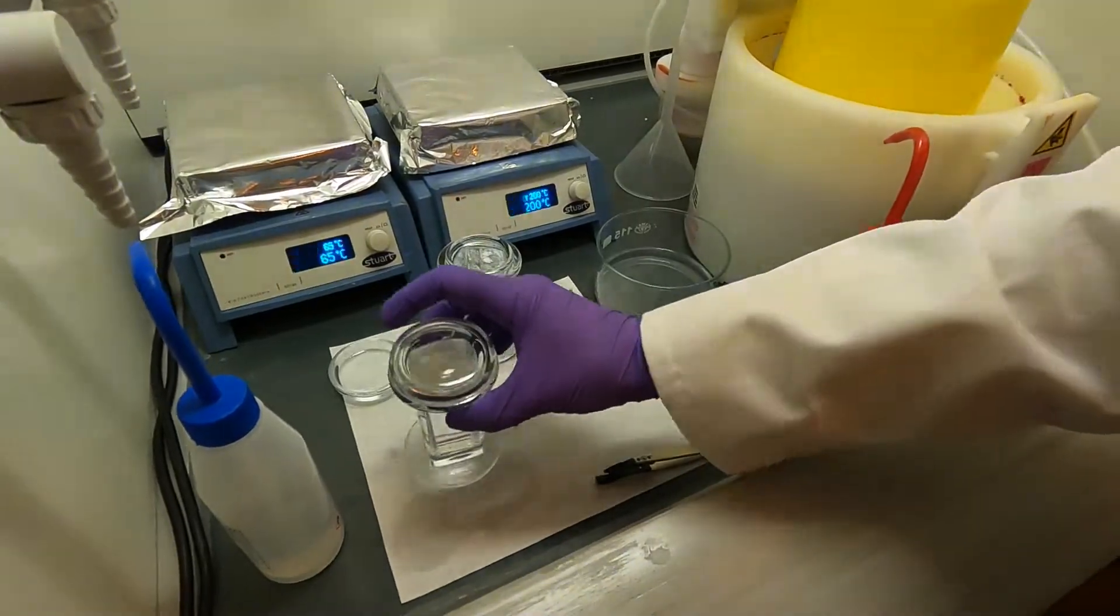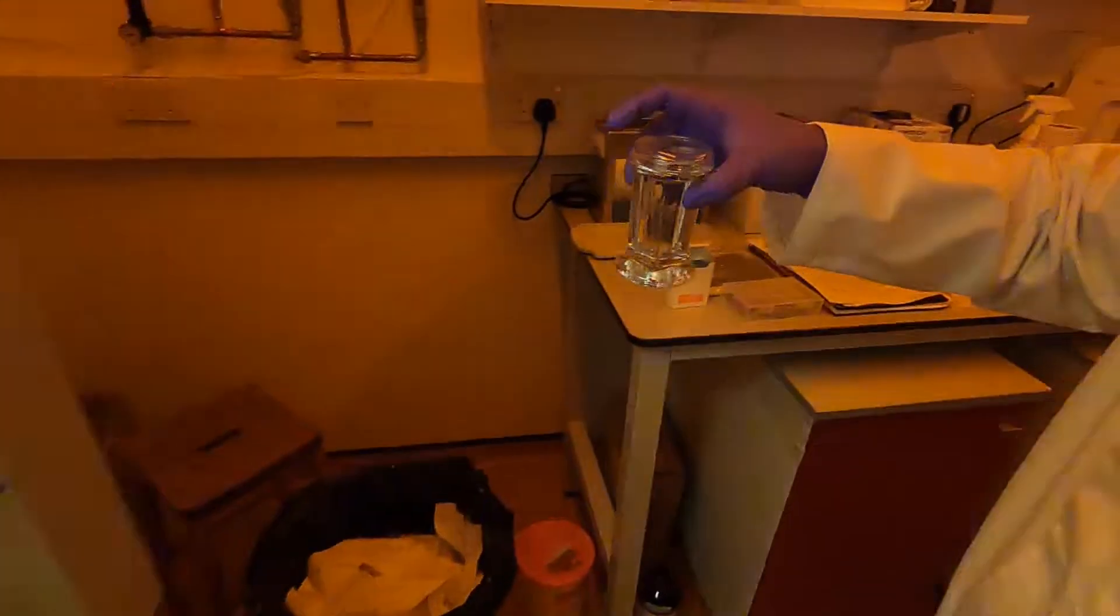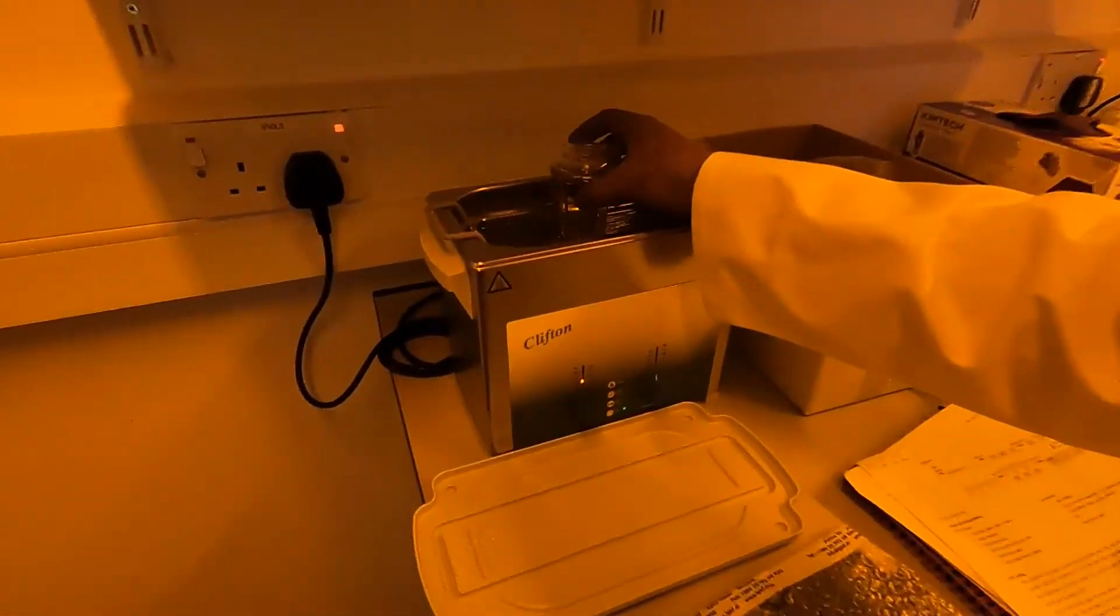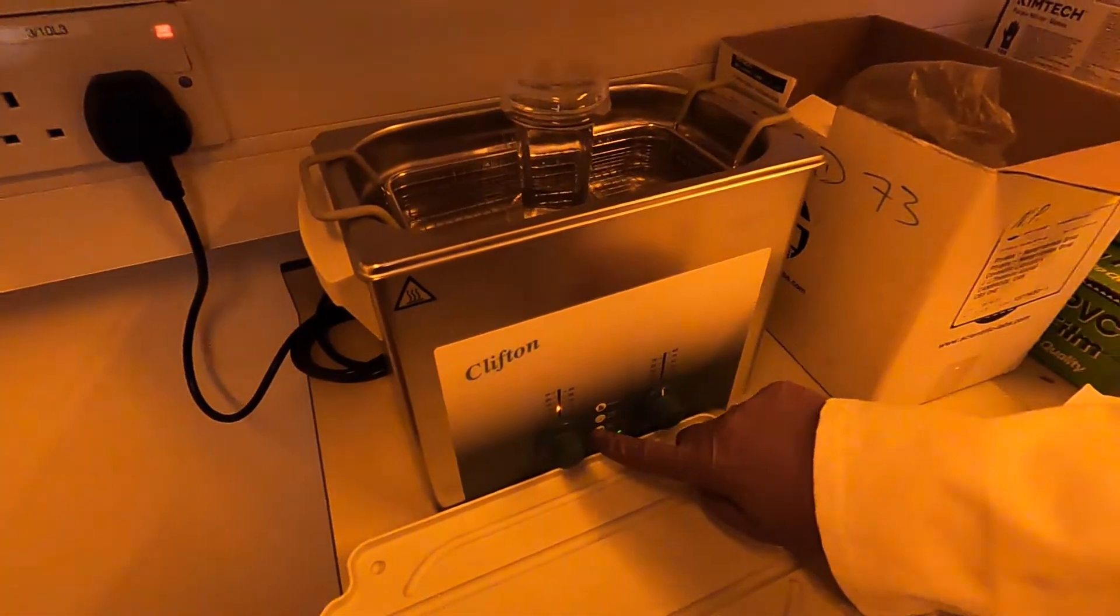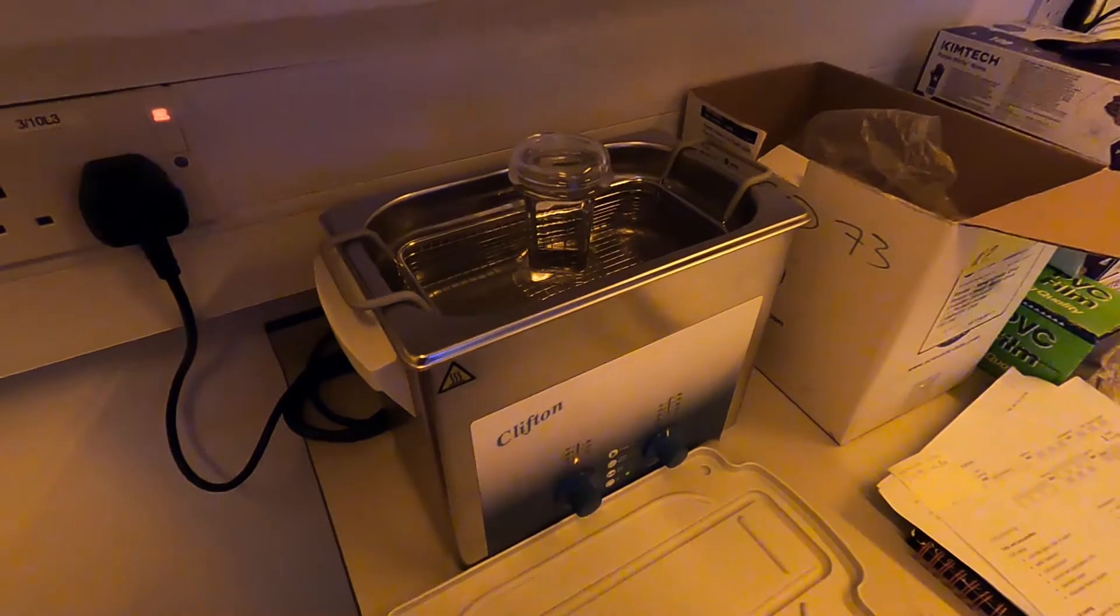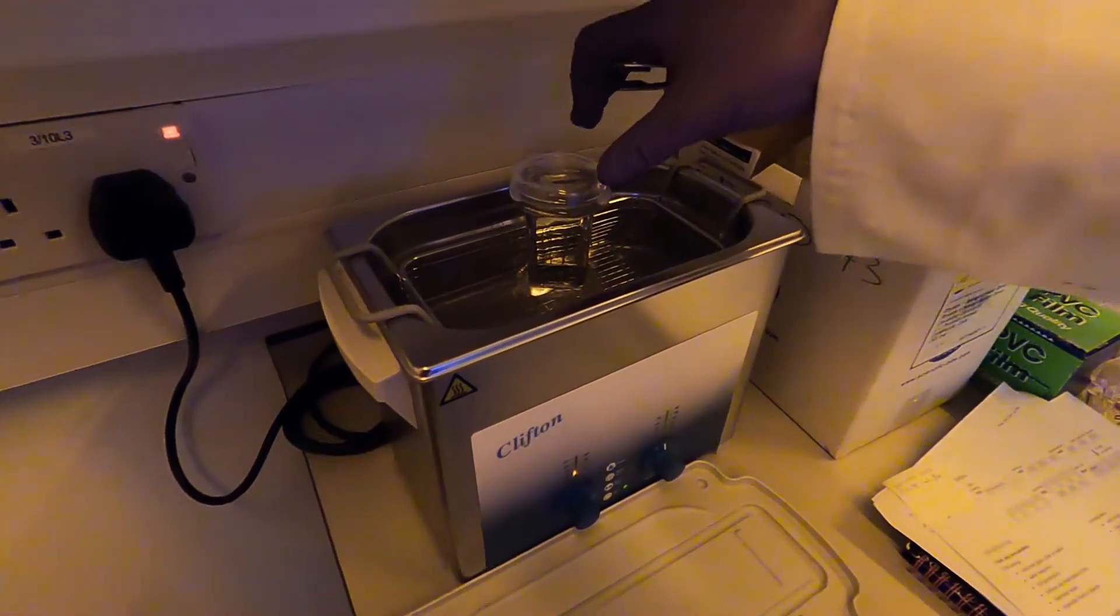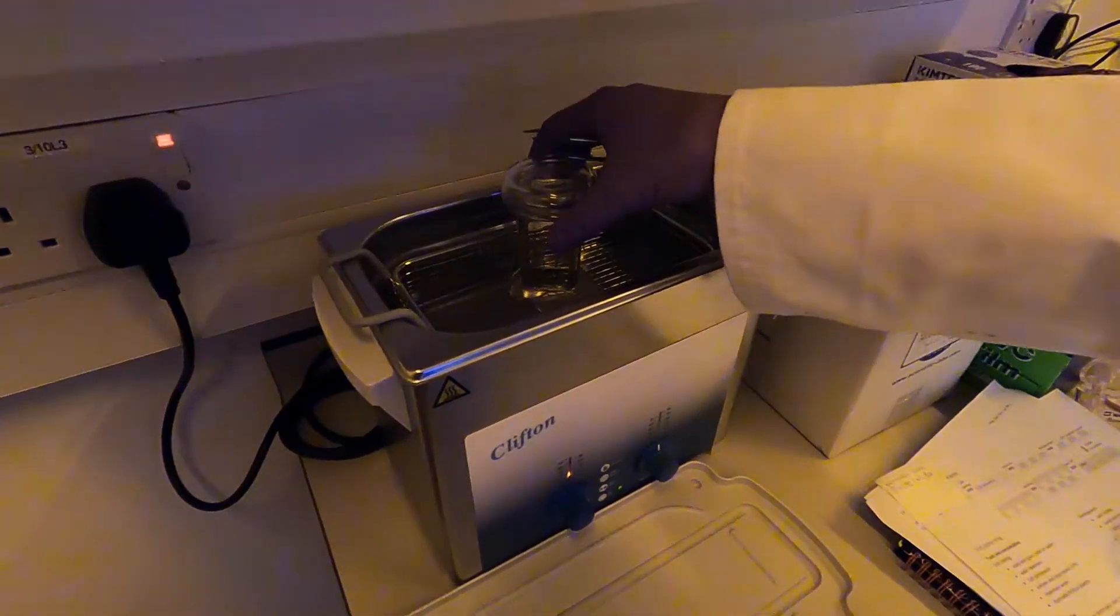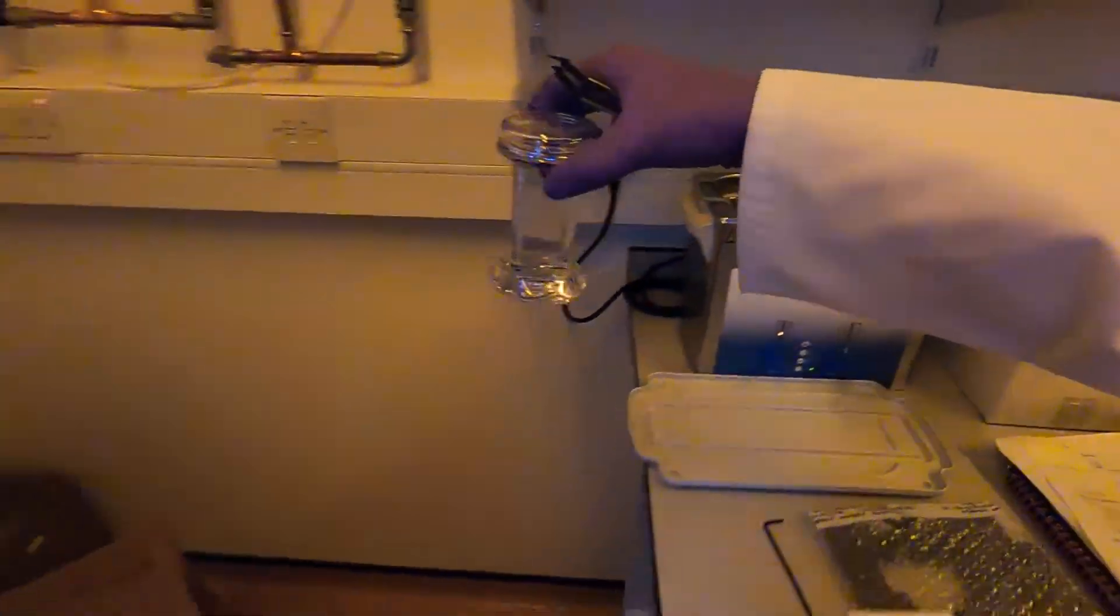Put the lid on and bring it back to the sonicator, and here we start sonicating for another five minutes. Okay, this has now been sonicating for five minutes in isopropanol, so I'm going to take it out and bring it back to the fume hood.